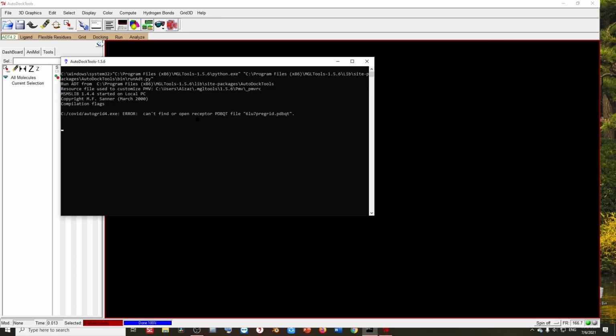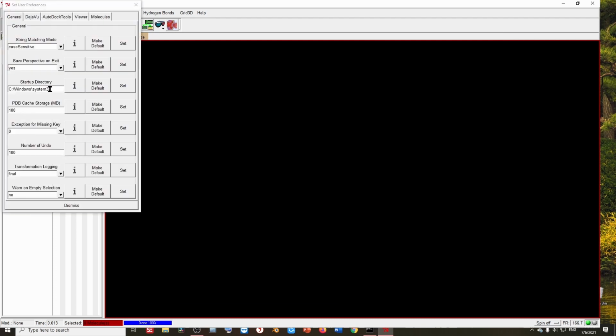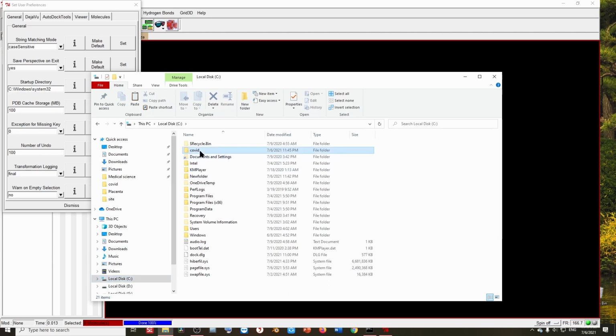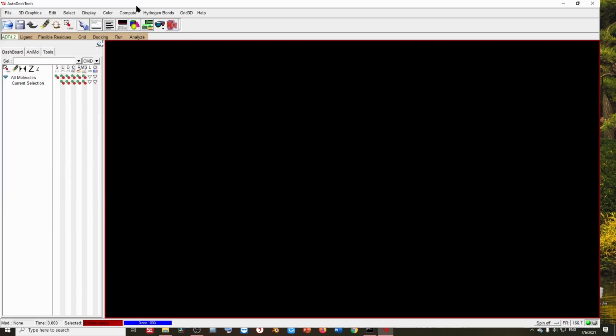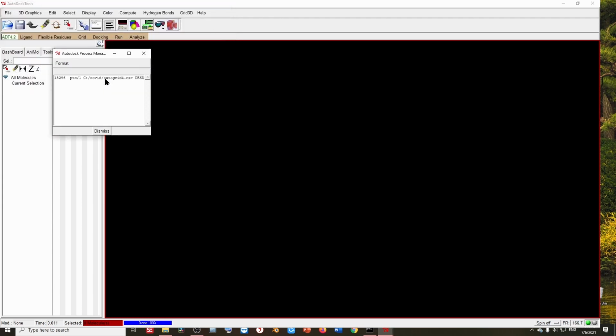So again, there is that same problem. Let's try to fix it in another way. Let's go to File, Preferences, and Set. Here I'm going to select the folder in which all my files are saved. In my case, it is C, COVID. Let's copy it, paste it here with Control V, set, and then click here. Now let's again try to run AutoGrid. Everything is set up. Let's go. Yeah, now it's working.